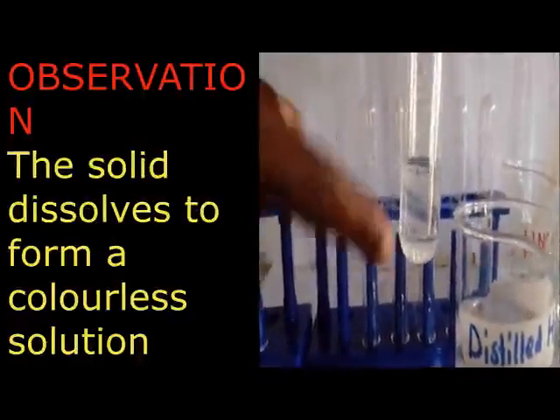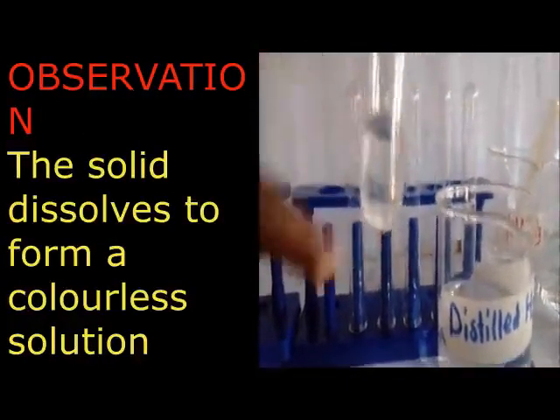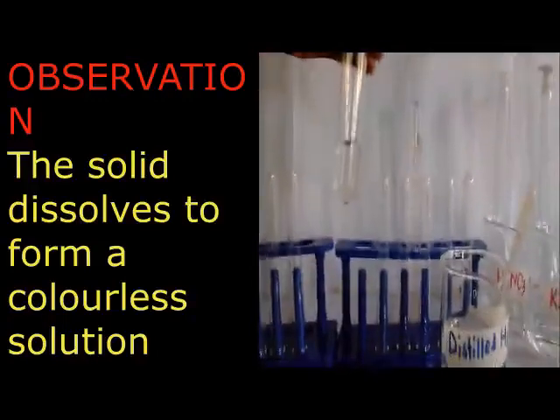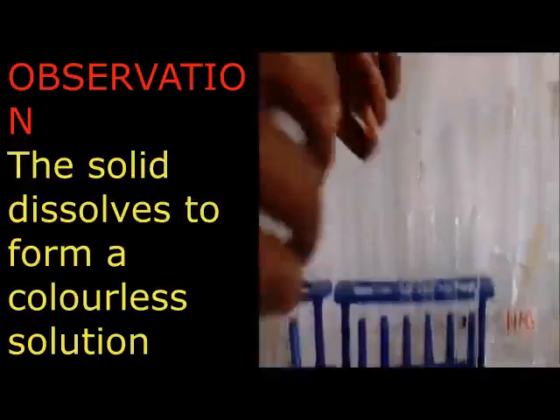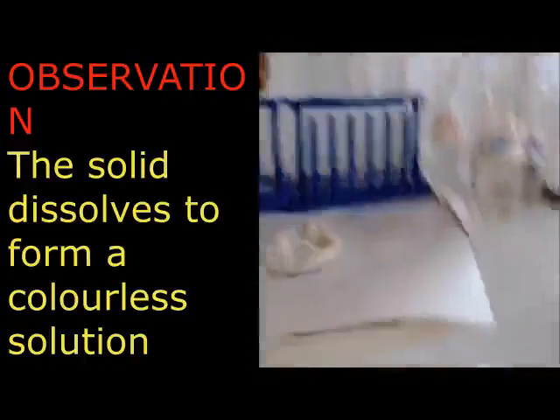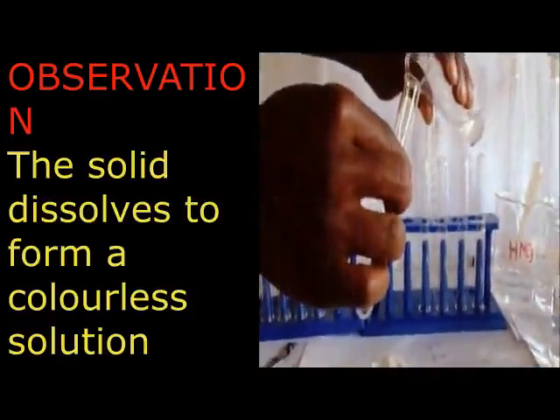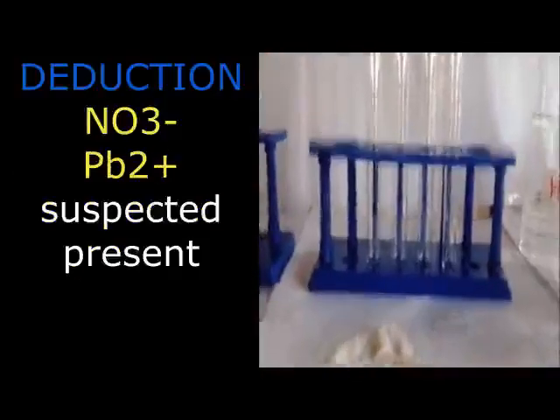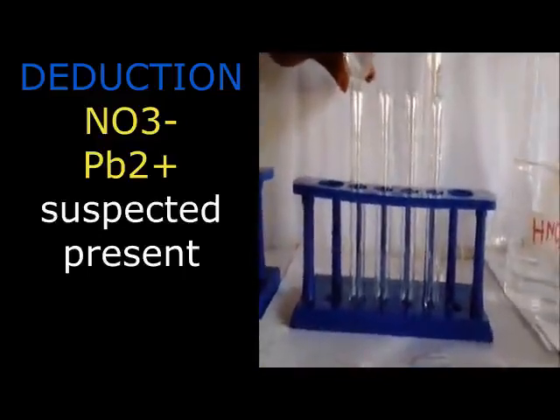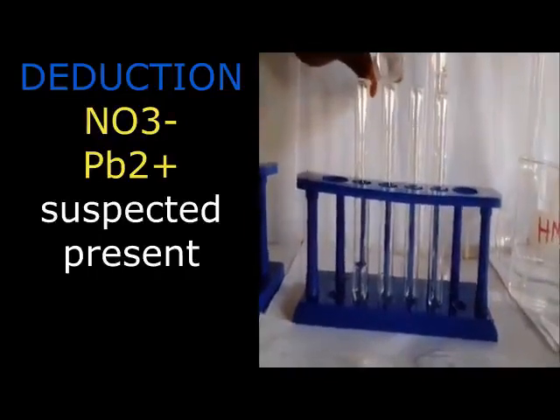Because we have observed, when heating as the preliminary test, we discovered that the salt may be containing lead. Because it's containing lead, now we have to maintain our lead as we are moving downwards. So at that point, we are going to say lead 2 ions suspectedly present. Then we are going to maintain our nitrate, suspectedly present, or our nitrate may be present or probably present.